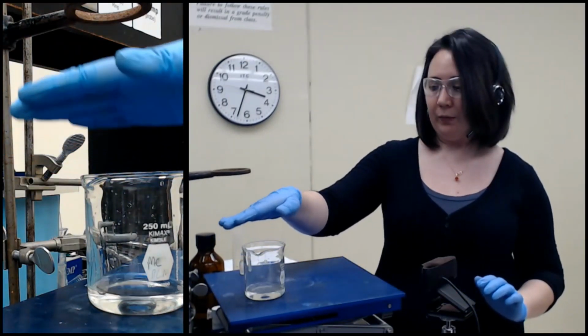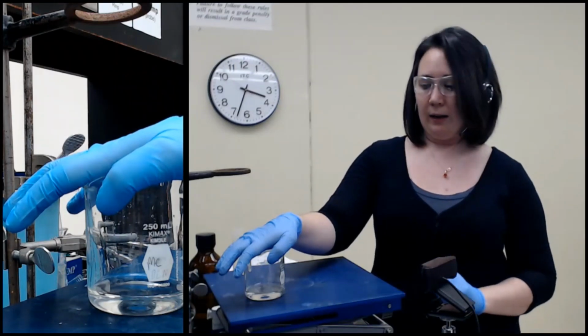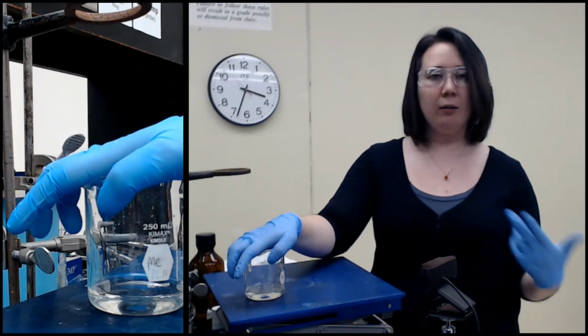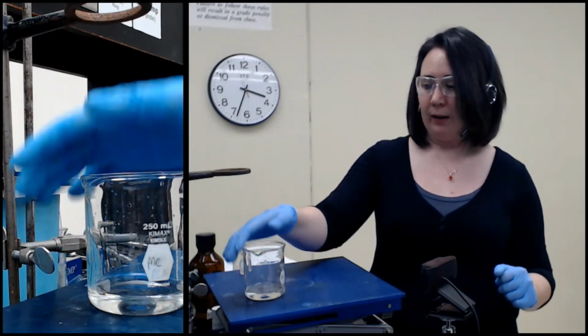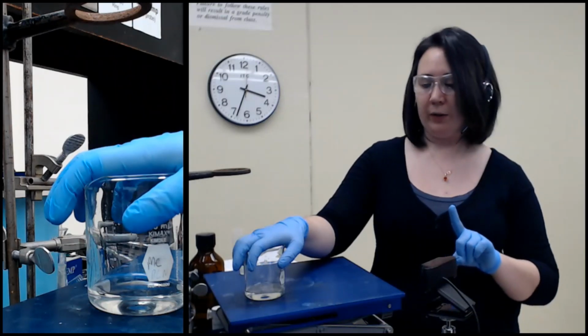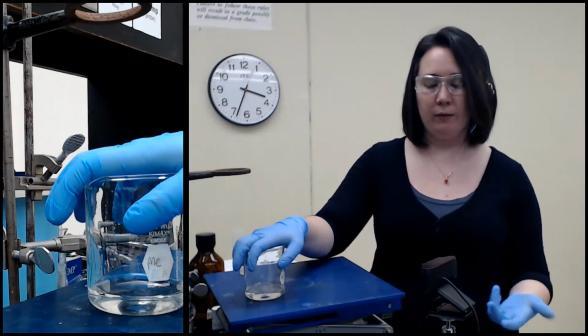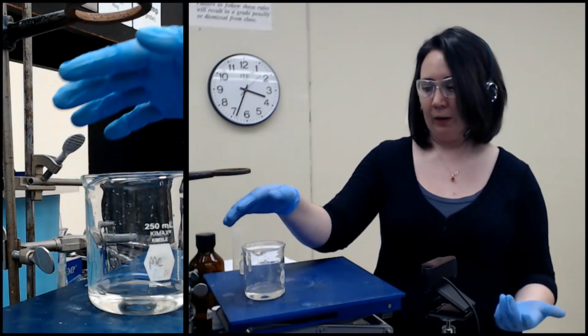So remember, this was our sodium bicarbonate layer, and it has the salt of something in it, so the salt of one of our three components. And what we need to do is get it back first as neutral, so we don't want the salt, we want the neutral version, and then separate it out from the water.